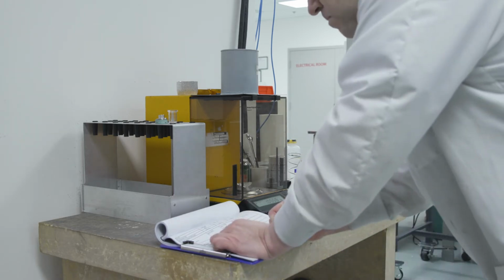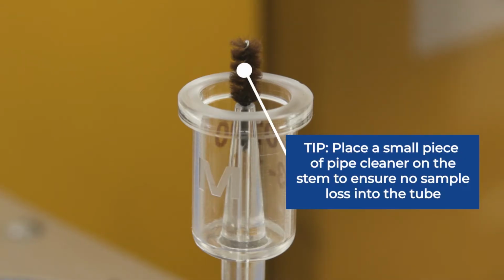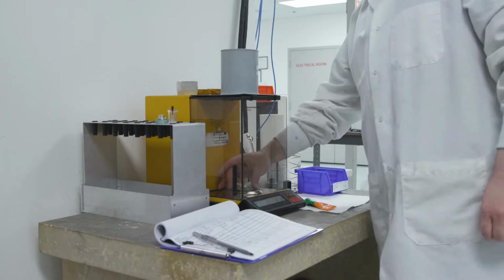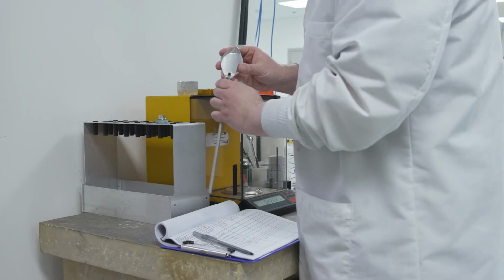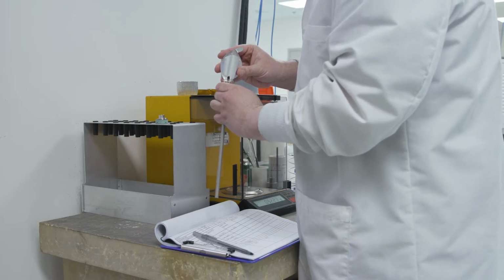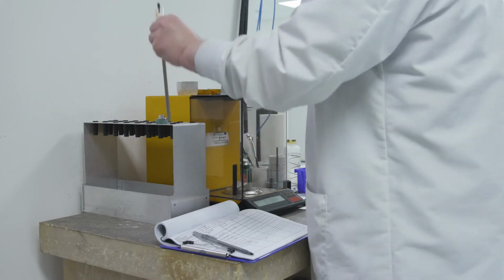Next, Chris is going to prepare to add sample to the penetrometer by placing a small piece of pipe cleaner into the top of the stem. When analyzing extrudates, such as this catalyst support, we use one of the powder penetrometers. For these, the stem extends up into the bowl. This helps to prevent sample from entering the stem during handling and analysis. The pipe cleaner makes it easier for Chris to add the sample to the bowl without sample entering the penetrometer stem. He uses the same technique when analyzing powdered samples.